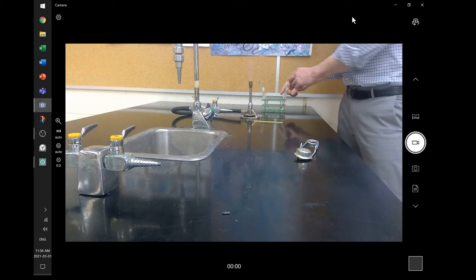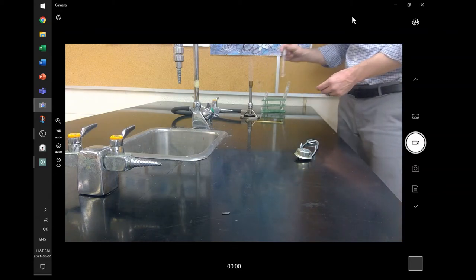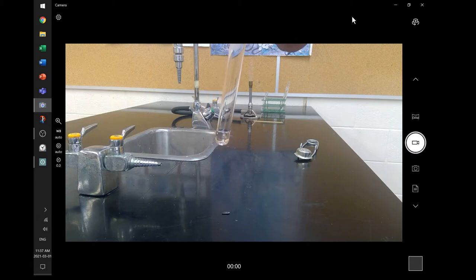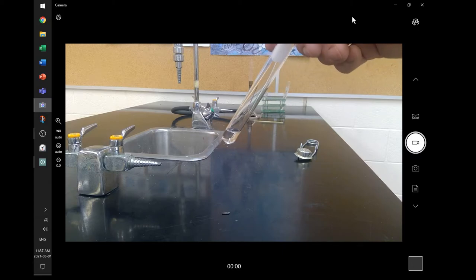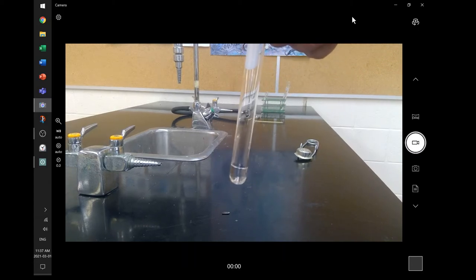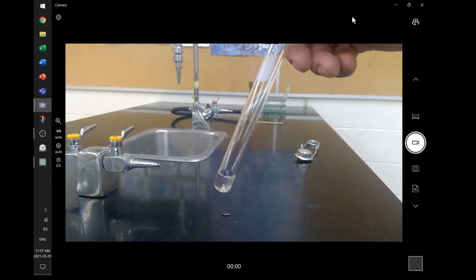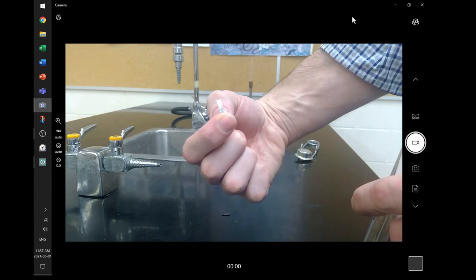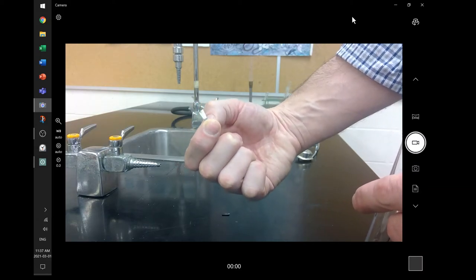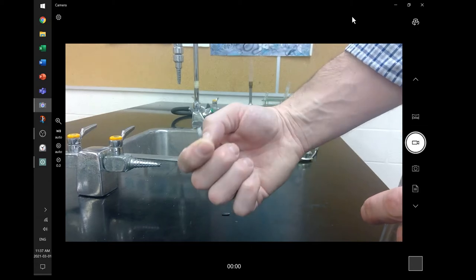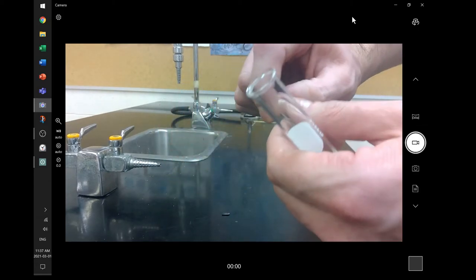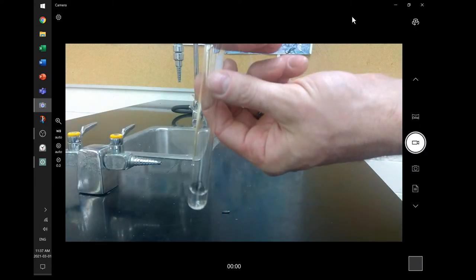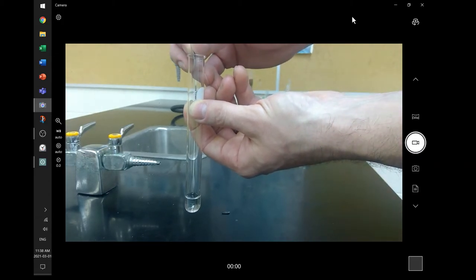So the first thing we want to do is produce the gases. To produce the gases, I'm going to run that first test that you see is hydrochloric acid and magnesium. Now, hydrochloric acid does not have really identifying physical properties. There's nothing I can do to look at that and say it's got this certain color or viscosity. It looks really just like water. There aren't great physical properties to help me to know what exactly that is. Now, the other thing that we're going to use, the other reactant, is magnesium ribbon. So it looks like a little piece of shiny tinfoil-ish kind of stuff. Kind of shiny, lustrous, hard, and I would think maybe three millimeters across or so. And all I really want to do is combine the magnesium with the hydrochloric acid and observe.